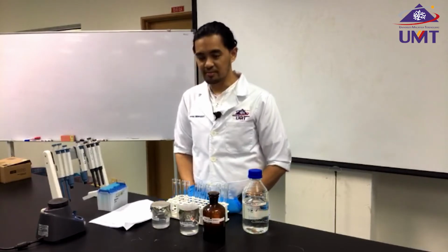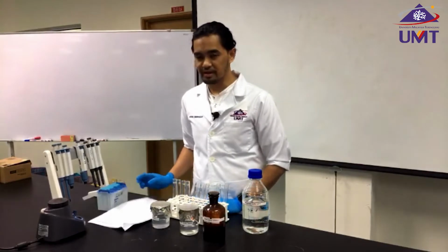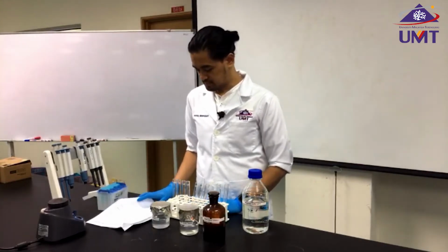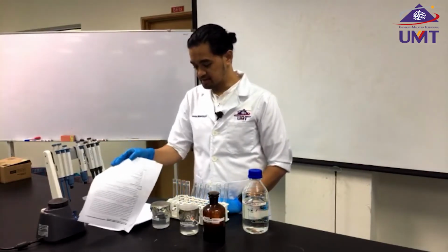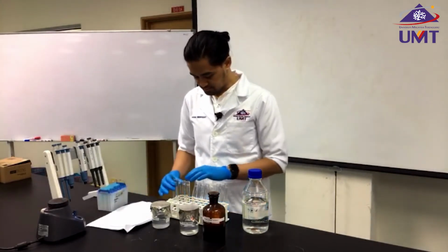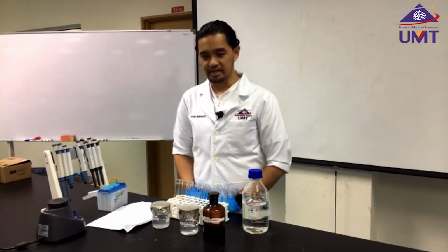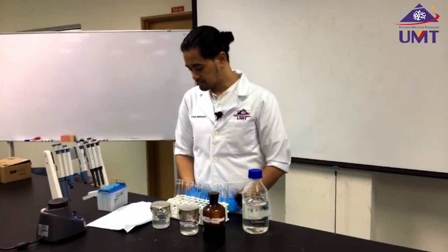There are two experiments I'm going to do today. The first one is to prepare the standard curve, and then the second experiment is on the kinetics of amylase. So this particular experiment is an application of all the previous experiments that you have learned in the previous lab sessions.